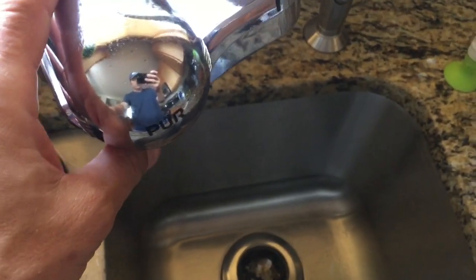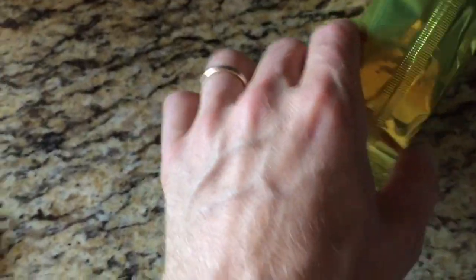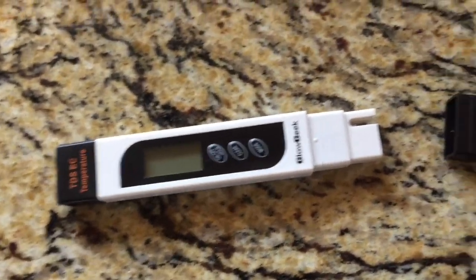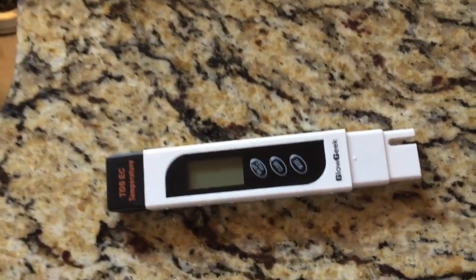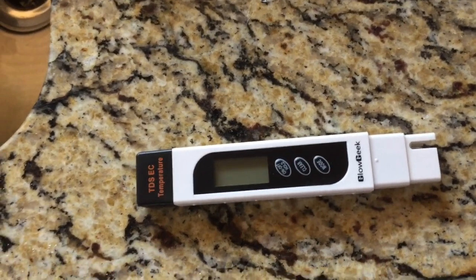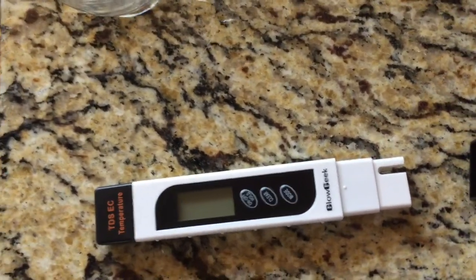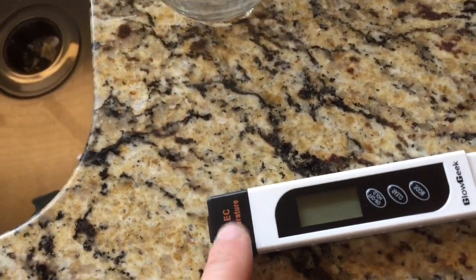Hello everybody, today I wanted to test this PUR water filter versus tap water versus a new filter I'm going to install. I have this TDS and EC meter. TDS stands for total dissolved solids per million, and EC stands for electrical conductivity. Pure H2O will be zero for both.